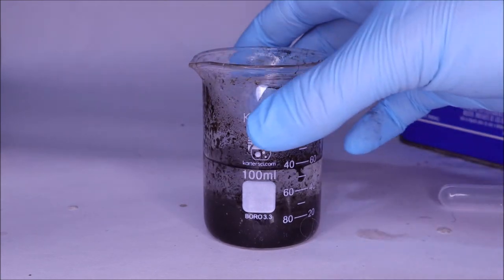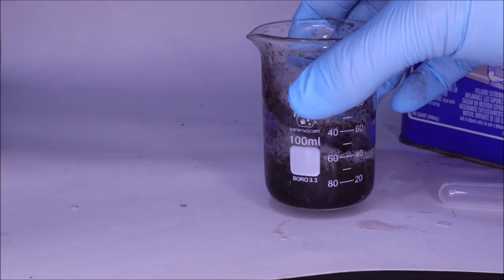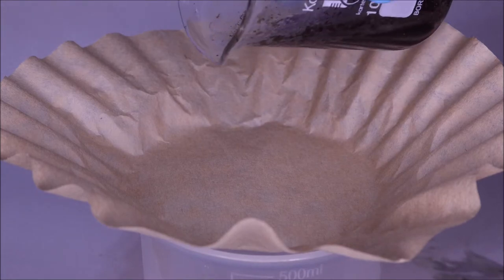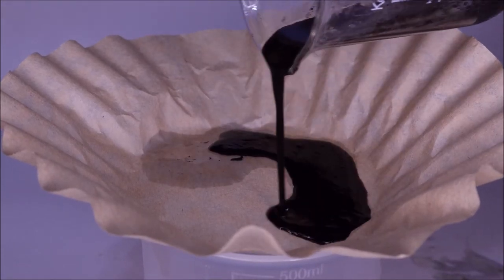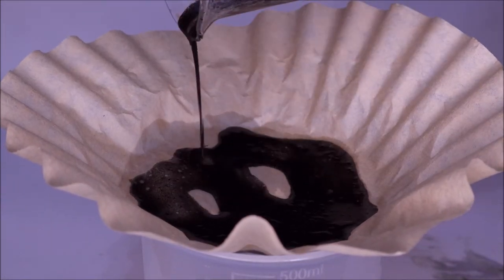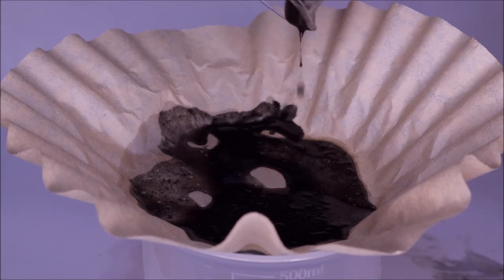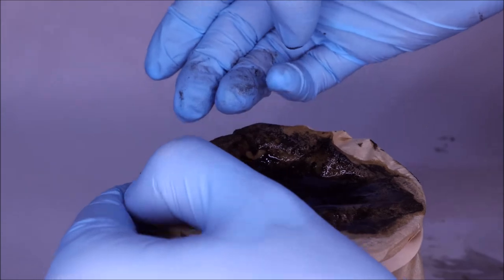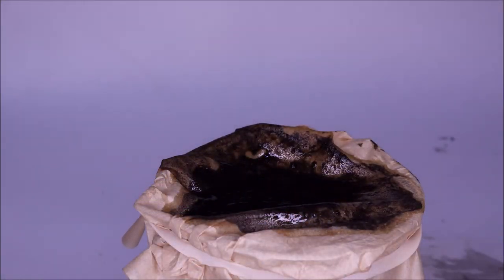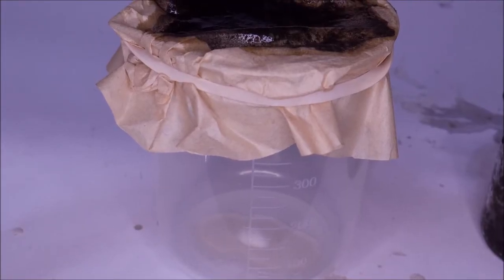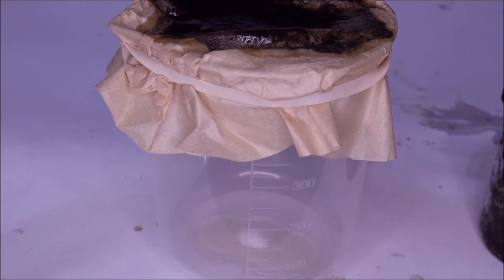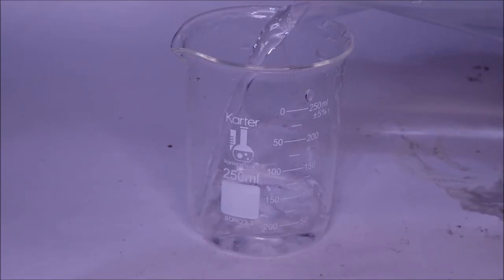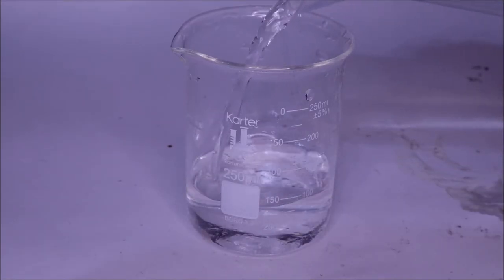I then had to try and filter it. This time I didn't really expect it to do much because as we saw before, sometimes these systems don't filter too well. Again I applied my rubber band system, and in this instance the material actually filtered a little bit.